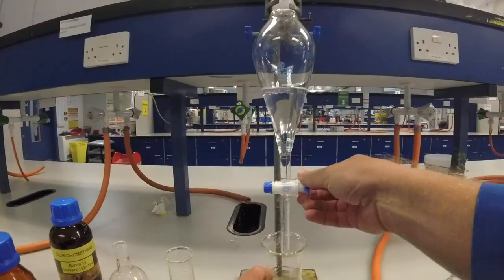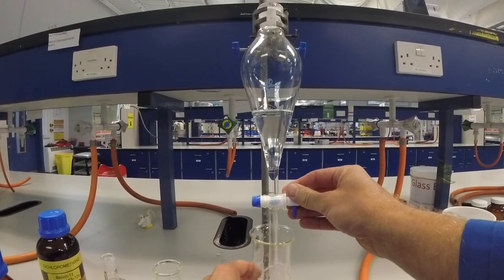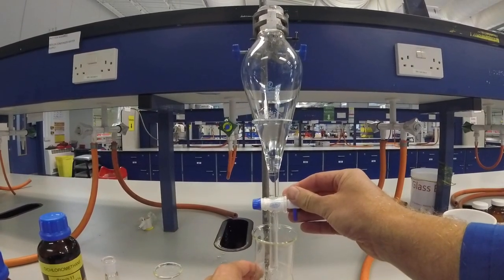And then we're going to run now the organic layer into another conical flask.